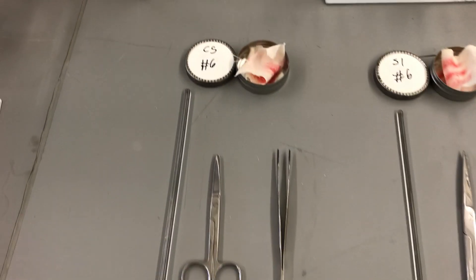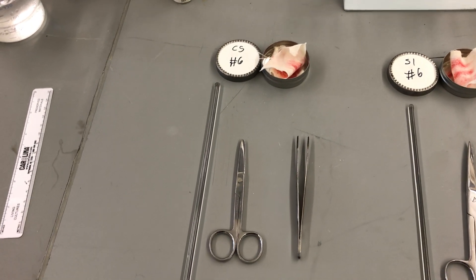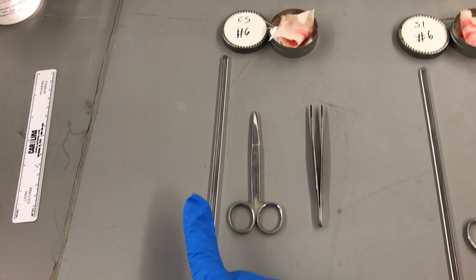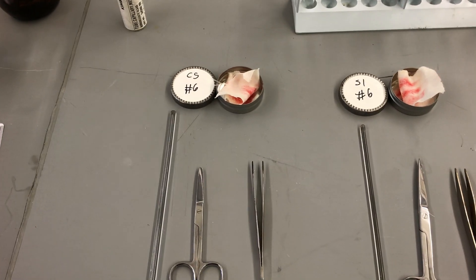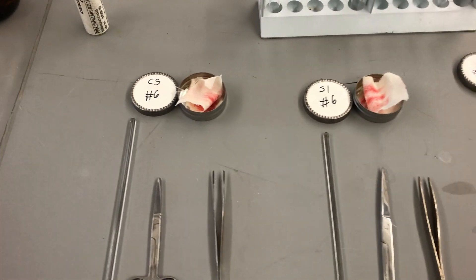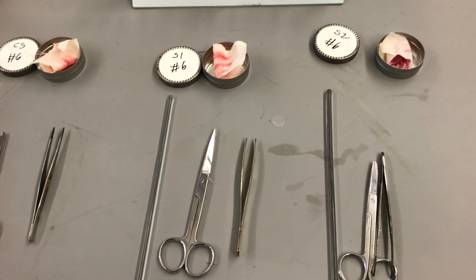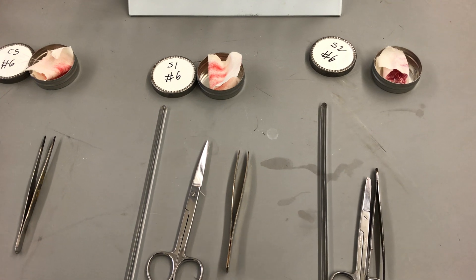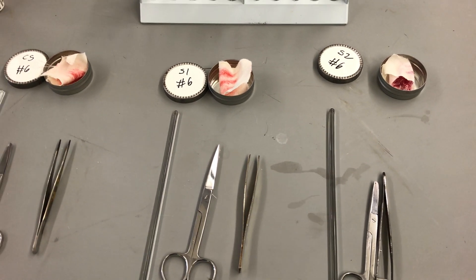For each different piece of evidence, we have different sets of equipment to use: stirring rods, scissors, and forceps. These are so we can handle the evidence properly without any cross-contamination. It's very easy to cross-contaminate our lipstick samples, and that will throw off our results — we won't get good results or a good comparison done.